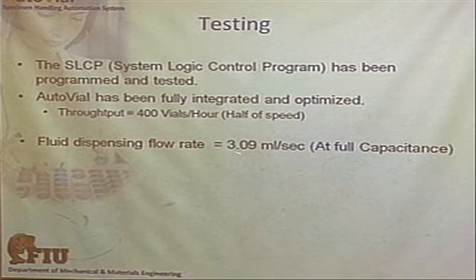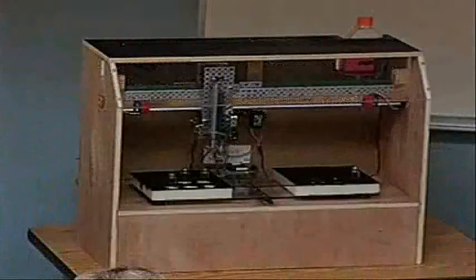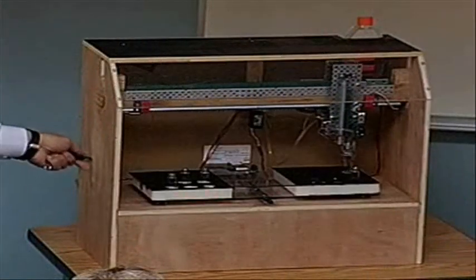As to the fluid dispensing flow rate, we can dispense 3.09 milliliters per second at full capacitance. Remember, we're using this for this flow rate. We can increase this by putting in a pump. And with this, we're going to show you a demonstration of it. The VTM moves forward.